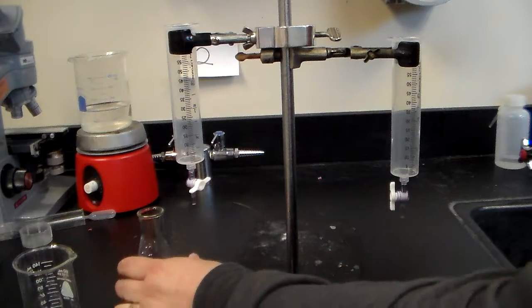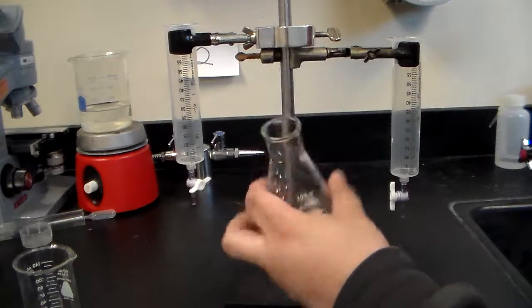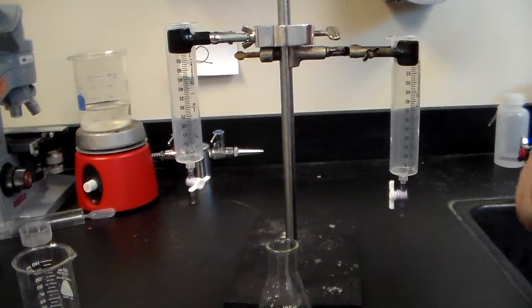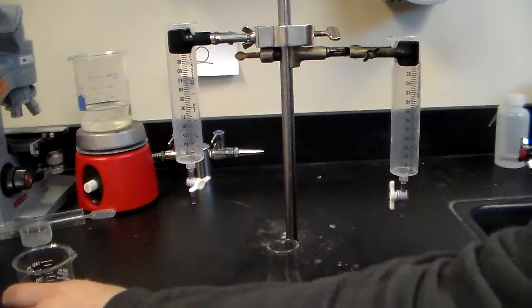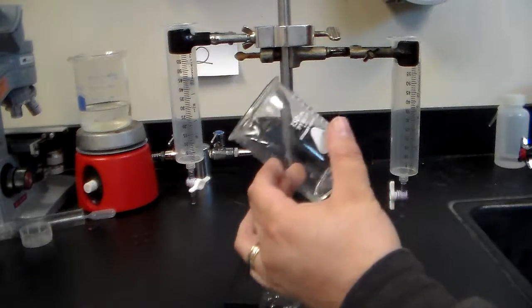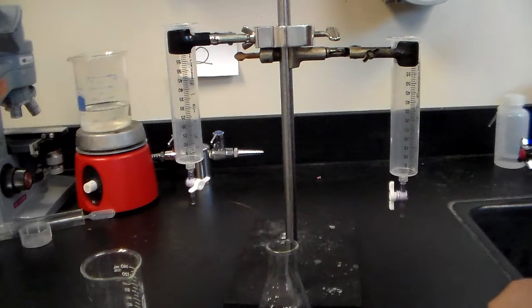We're also going to need a testing flask. That's this right here, because that's what we're going to actually run our tests on. The other thing we're going to need is a beaker that's going to be our trash beaker, our waste beaker if you will.